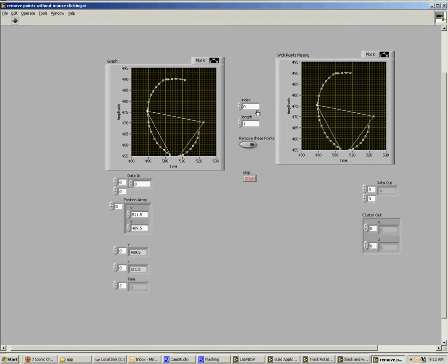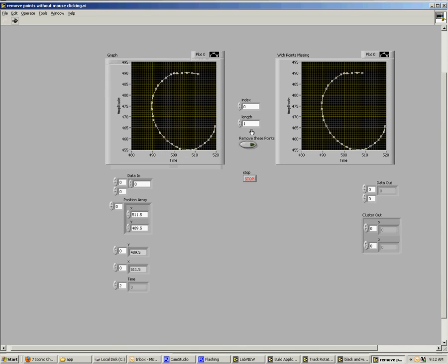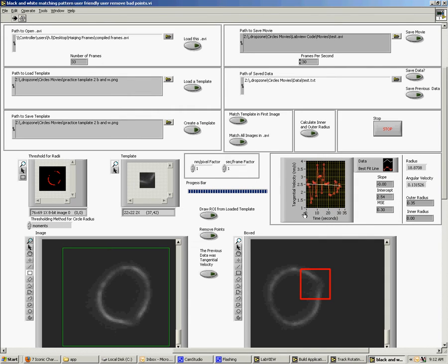Here we go. Now what we're looking at here is position versus time. And again, we're going to want to delete these poor points out of it. There we go. Remove this point. Now, this should look like the outline of the ellipse that you were just looking at, and indeed it does. So let's click the stop button. And now this graph is updated to show tangential velocity on the y-axis and time on the x. It should have about a slope of 0, which it does. This will then tell you the angular velocity from that. This will find the average tangential velocity divided by the radius and give you the angular velocity.